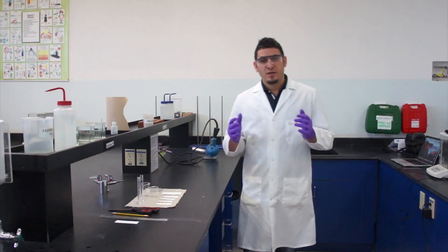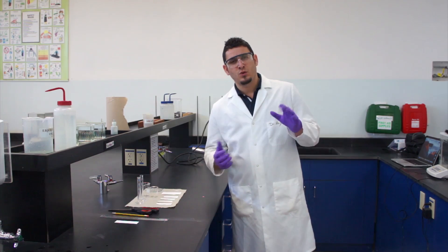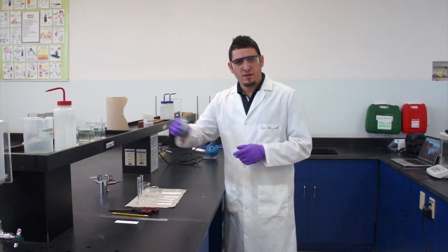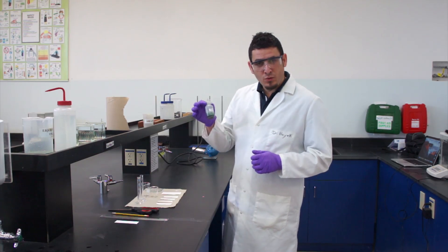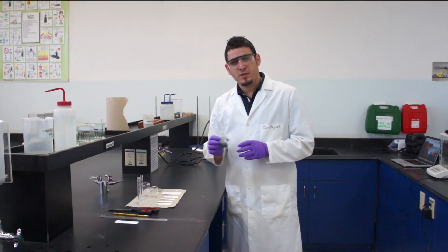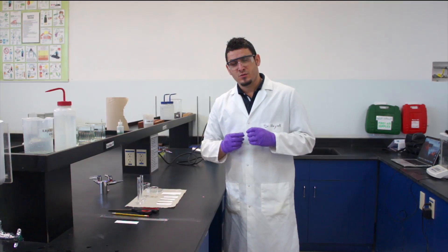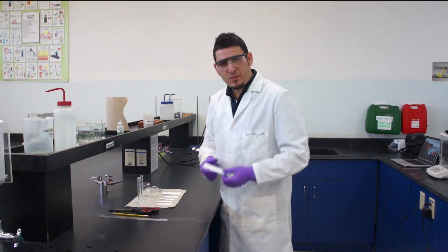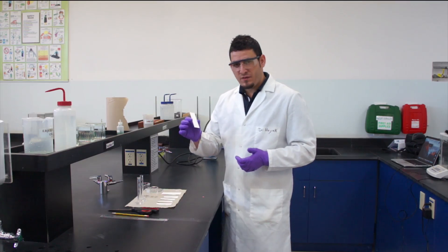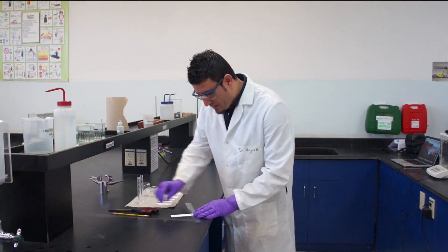Now let's look at the experimental procedure. We are given a mixture of three dyes — blue, red, and yellow — so the mixture will look green. We will put our mixture on the paper and run it to observe the separation. Before that, we need to prepare our paper. The first important detail is that the starting line on the paper must not touch the solvent inside the beaker, so we draw the starting line about one centimeter high.